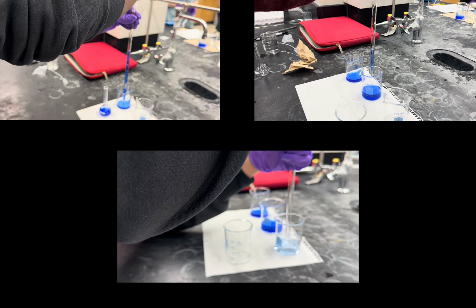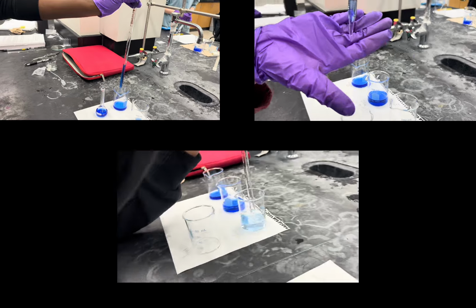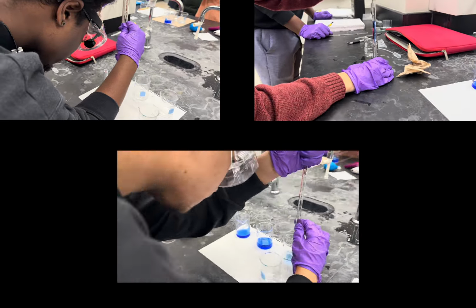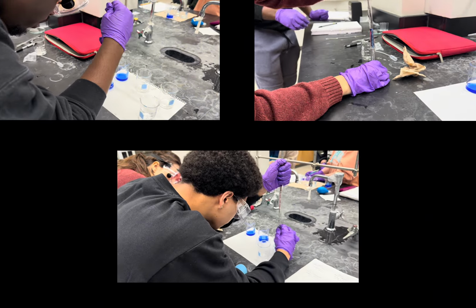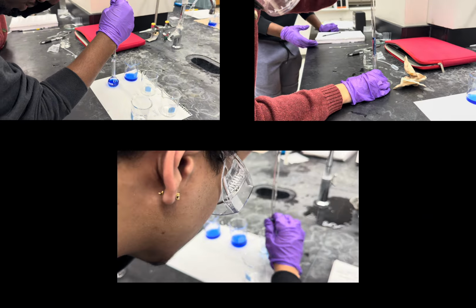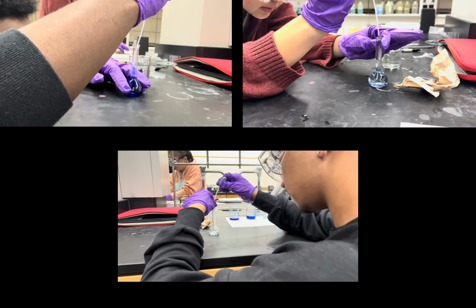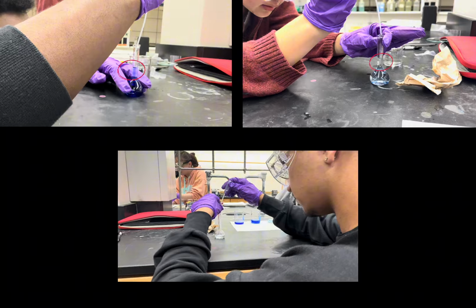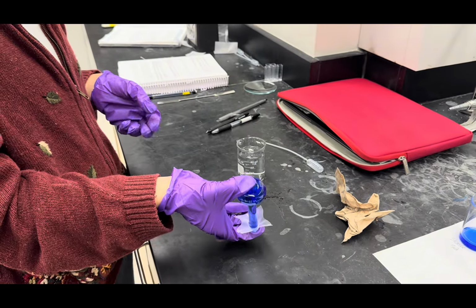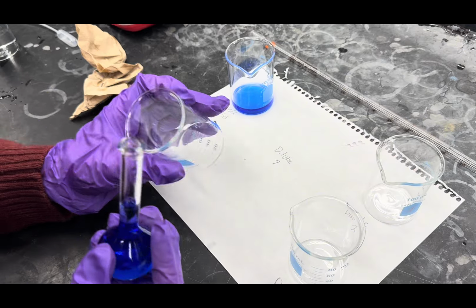Once the first solution and equations are set up for the dilutions, start by using the primed pipette to quantitatively transfer a small portion of stock solution to the 25 milliliter volumetric flask, based on the results from the dilution equation we went over earlier. Add water until the meniscus sits just on the line. Then, place the cap of the flask on and mix the dilution before transferring it to a clean beaker.